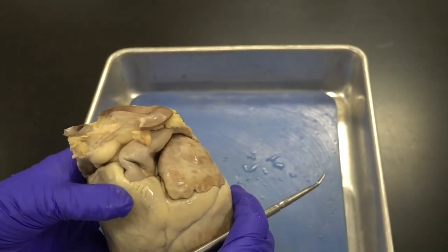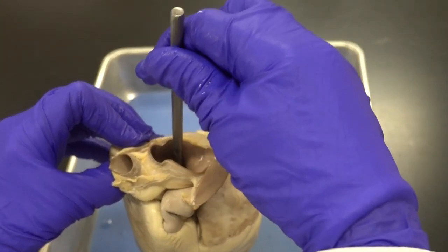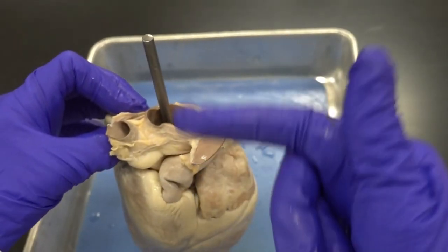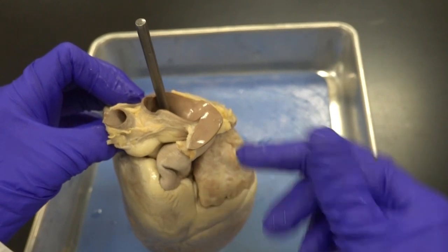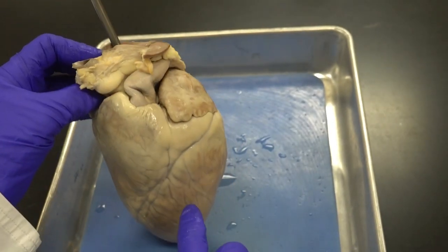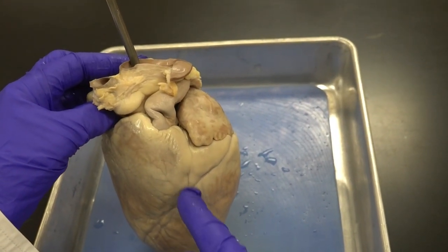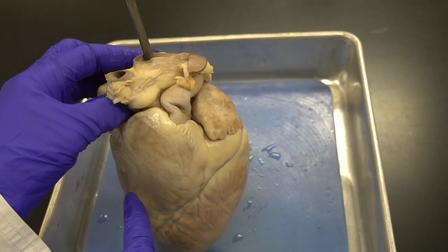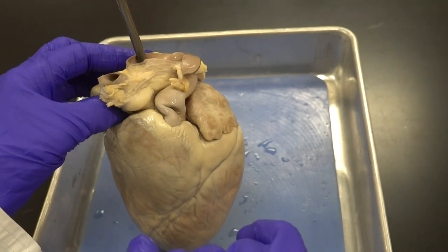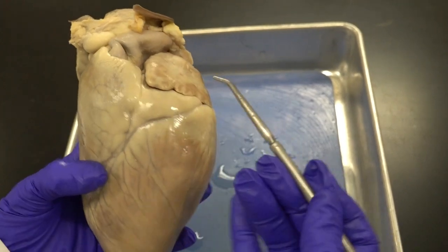The pulmonary trunk is easy to find in the anterior view. The other wide-open artery here is the aorta. When I place my instrument inside the aorta, the rest of the instrument is inside the left ventricle — confirming that the left ventricle pumps oxygenated blood into the aorta, while the right ventricle pumps deoxygenated blood into the pulmonary trunk.